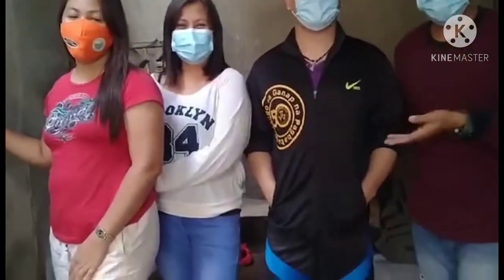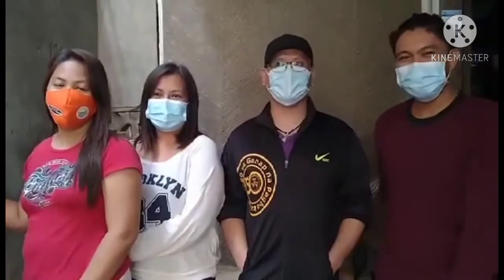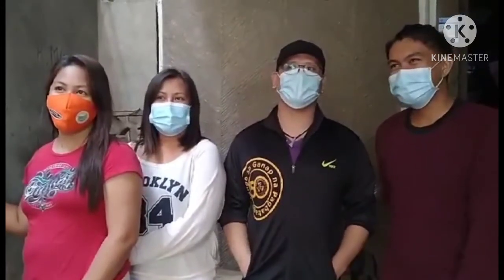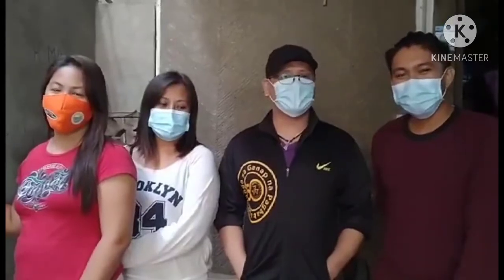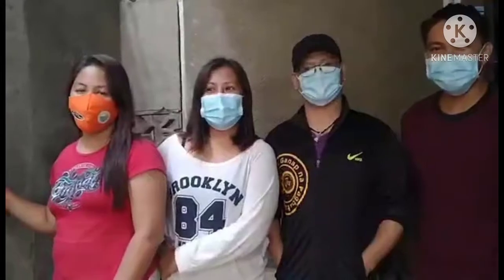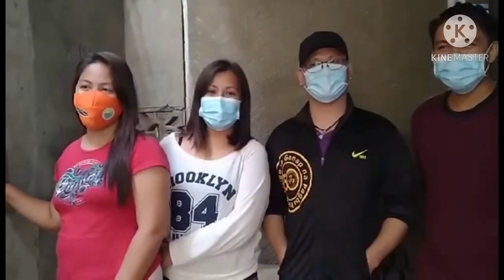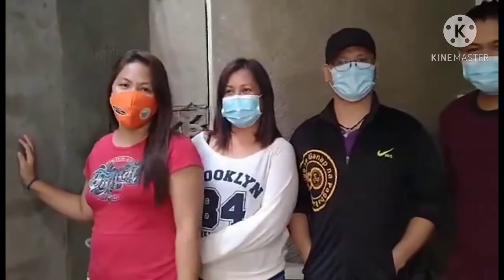Good afternoon, everyone. My name is Januel Boyser, and we are from Dissecting English 2B, and I'm with... I'm Adrian A. Medrano, and we are conducting a documentation as a requirement for our biological science subject. And I'm Lisa Leonardo, and we are about to show you how to dissect the gumamela flower. And I am Laila Nabiliana, and identify its parts.